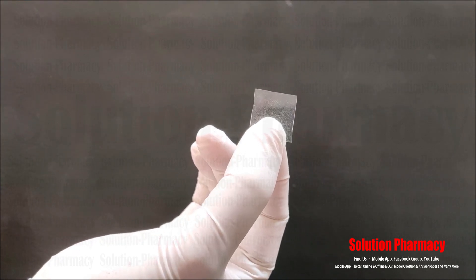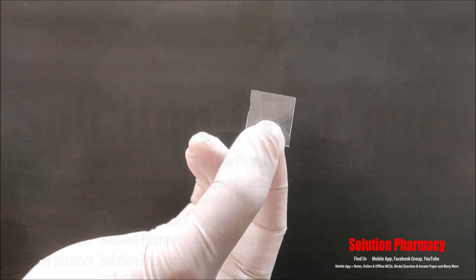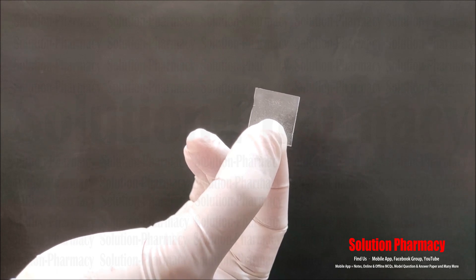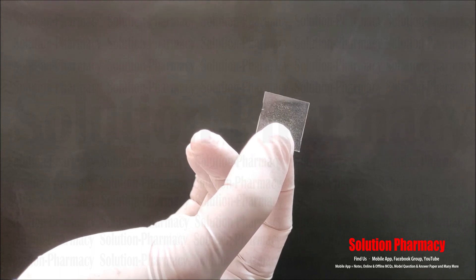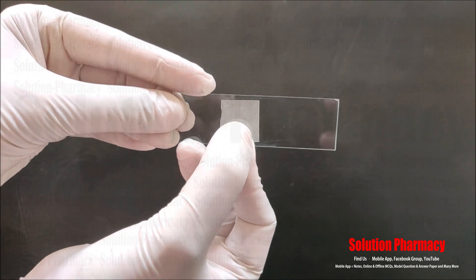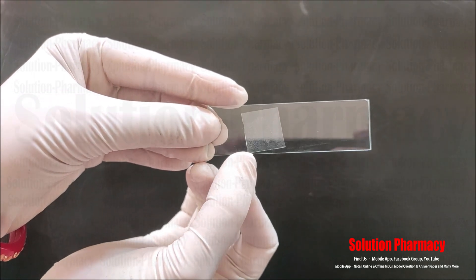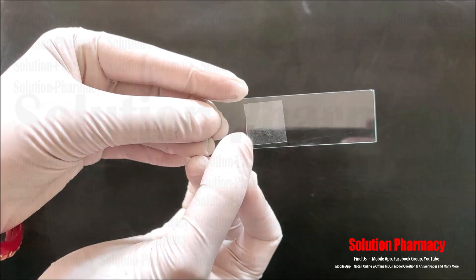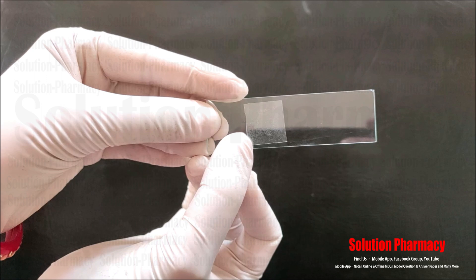Next, this is called a cover slip. As you can see in the video, this is a very thin piece of glass of square shape. When we place a specimen on a glass slide to be examined under the microscope — a thin tissue section of plants or animals, or a blood sample — we have to cover this specimen with this cover slip.